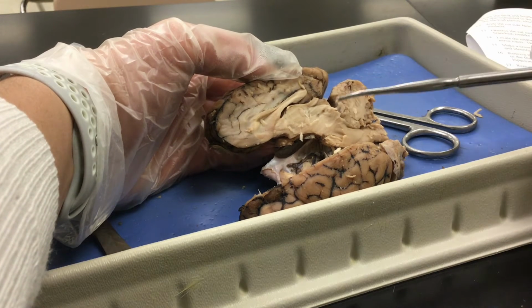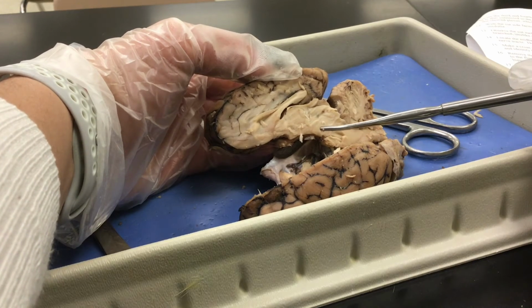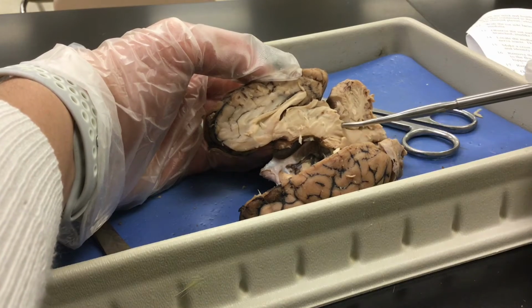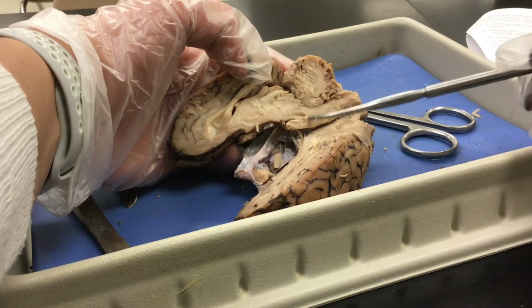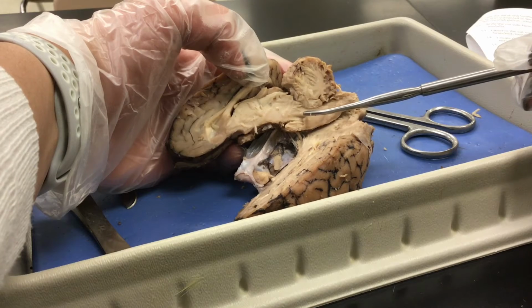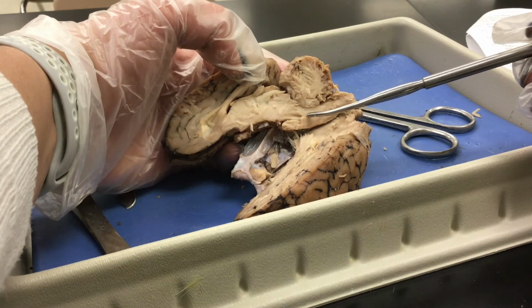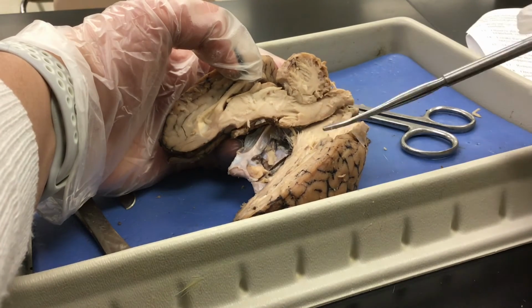Moving down, we have the midbrain here. The midbrain sends auditory information to the thalamus and combines the visual, auditory, and somatosensory information. The pons is here. I kind of butchered it, my bad, but this is the pons. And the pons helps regulate your REM sleep, your REM cycle, and receives some of that descending information through the spinal cord. Pons is Latin for bridge between the cerebellum and the rest of the central nervous system.